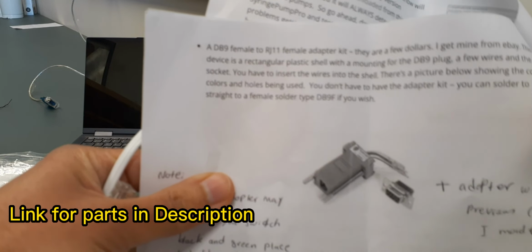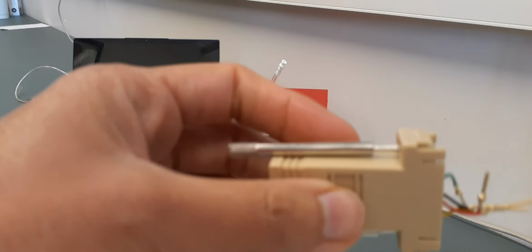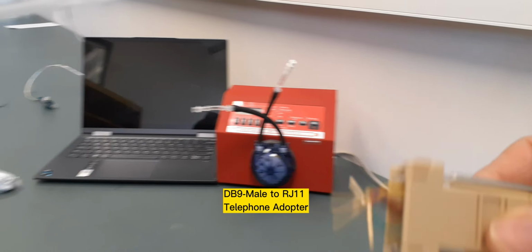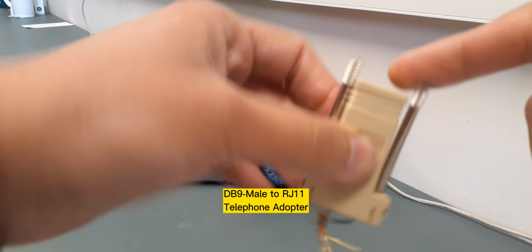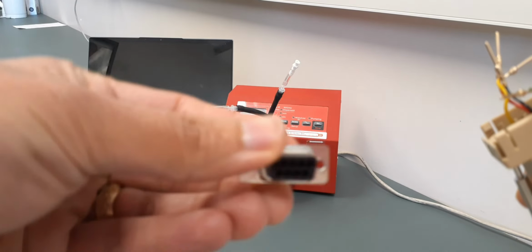So based on here, you will need to use this kit, which I have bought. This is a kit. It's called DB9 male RJ11 adapter. So basically this is the RJ11 and DB9 adapter. It comes with this part as well.